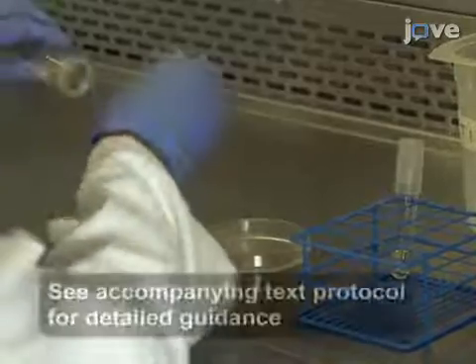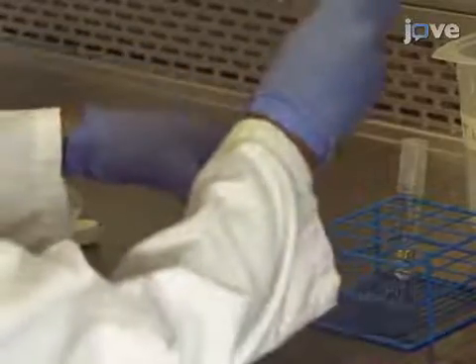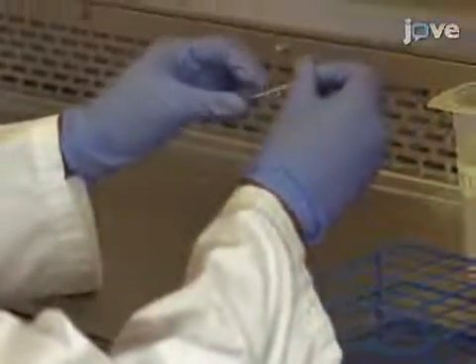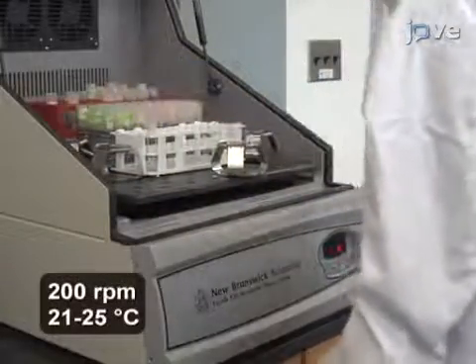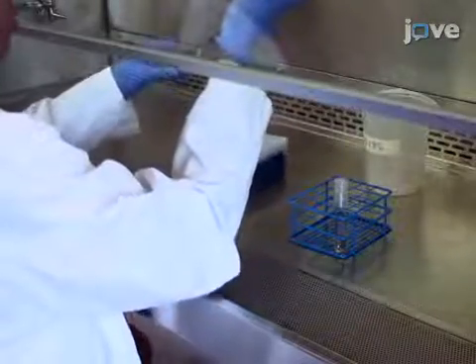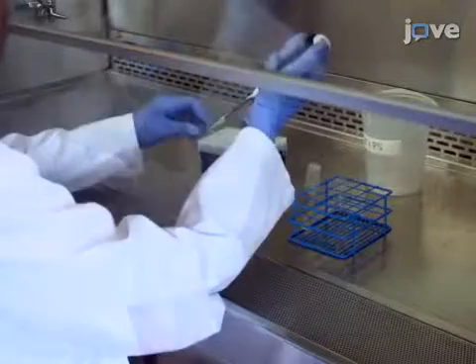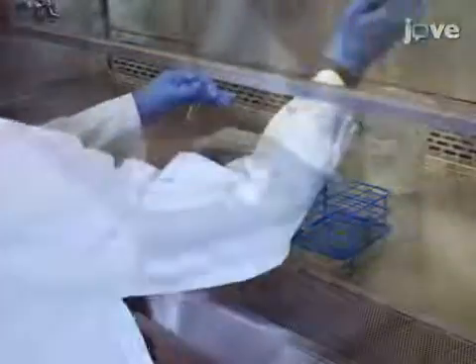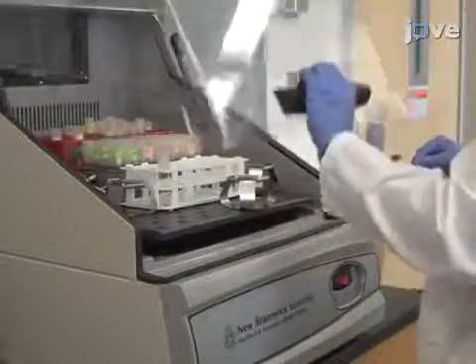To begin the experiment, inoculate a single colony of P. syringae into three milliliters of King's medium B broth, or KB. Incubate the culture overnight. The following morning, dilute the broth culture at 1 to 100 into 3 milliliters of fresh KB broth. Incubate the culture for 3 to 4 hours with shaking at room temperature.